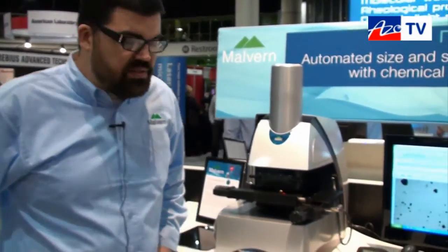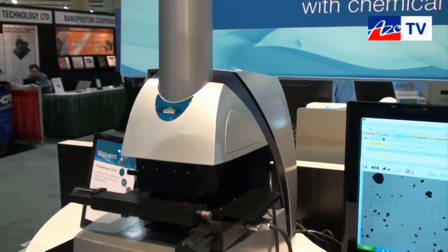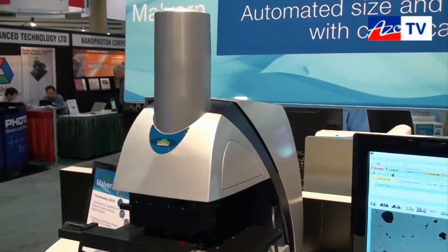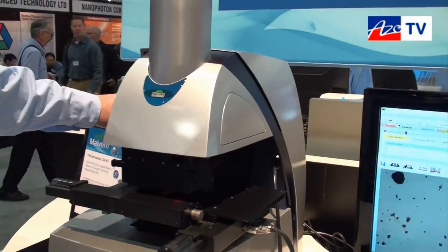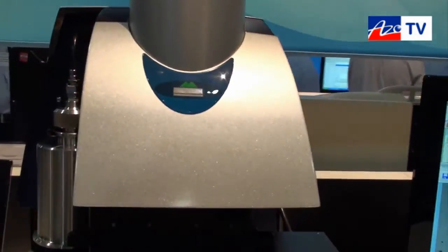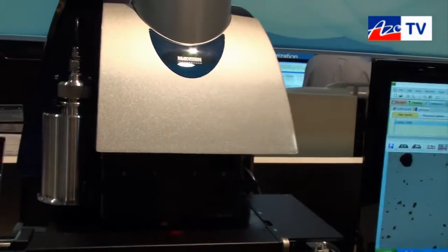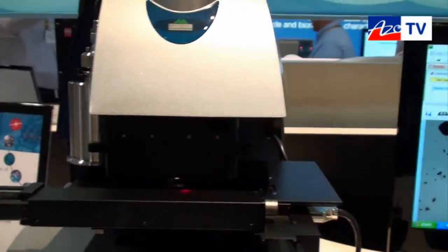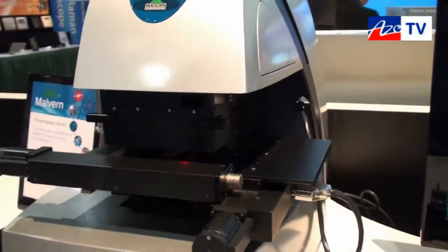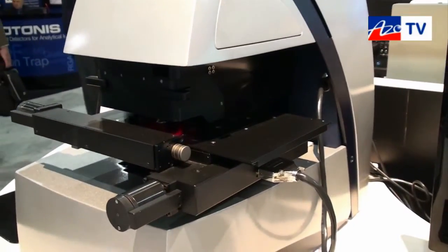Thank you, Cameron. As Cameron mentioned, this is a brand new system from Malvern Instruments — it's the G3ID. It's built around our classical G3S platform, which features onboard sample dispersion. What we've done is add the capability of doing Raman spectroscopy to a traditional particle size and particle shape investigation by optical microscopy.